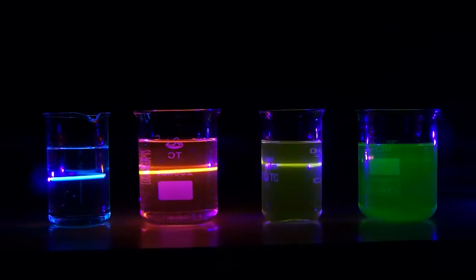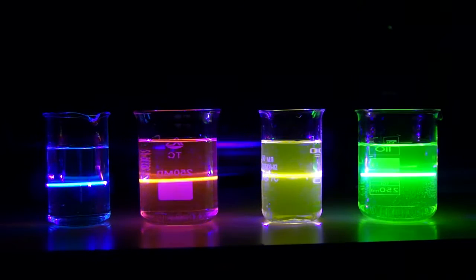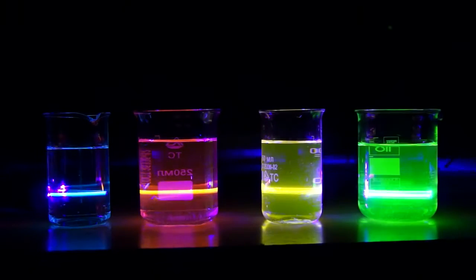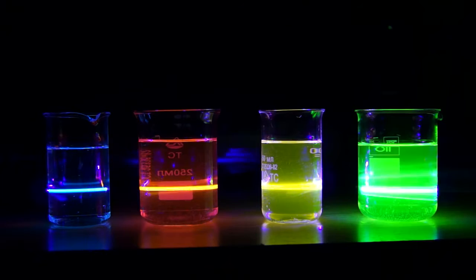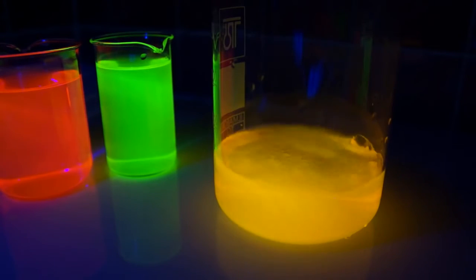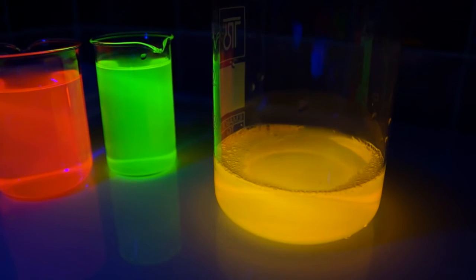However, you can force these solutions to emit light not only by UV light lamps. You can also take a violet laser and shine it through the solution. In this case, you can observe a beautiful light beam which is painted in every beaker in their respective color. Let's try and mix several different solutions of fluorophores and see what color it will produce.